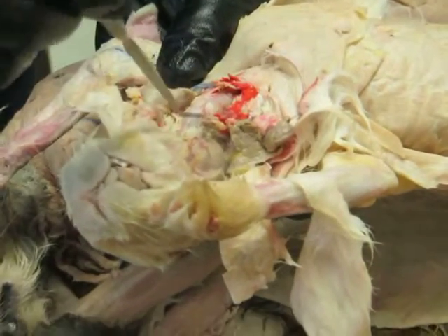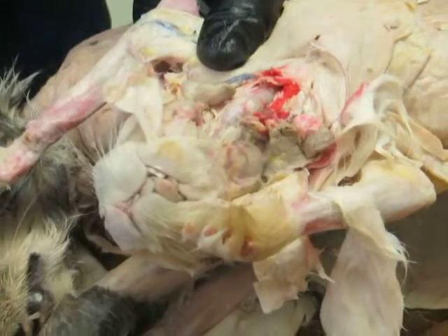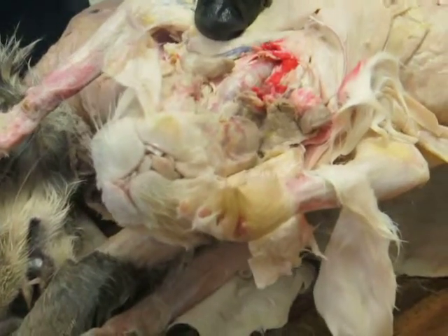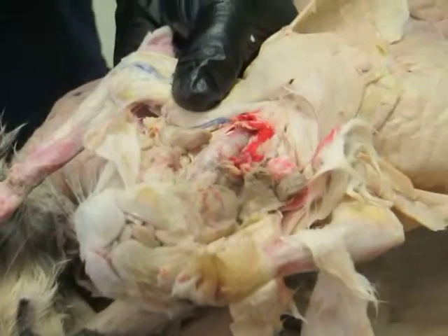Okay. So that's what does that belong to, by the way? The geniohyoid, which group of muscles? Hypobranchial muscle? Hypobranchial. So that's the last of the hypobranchial muscles.